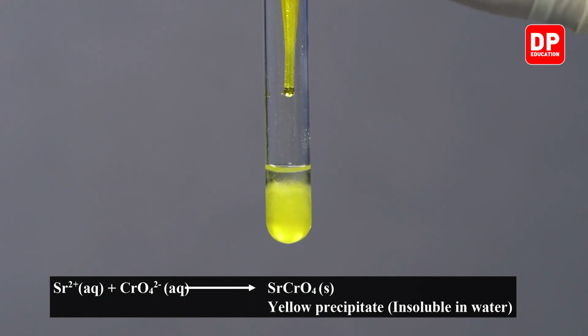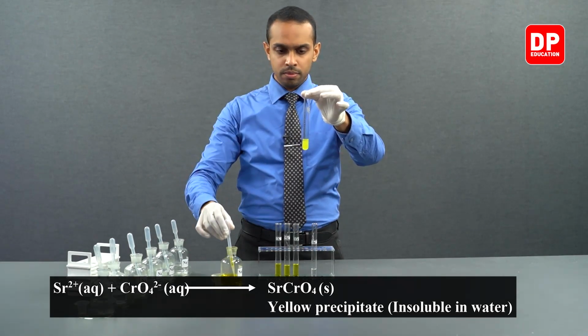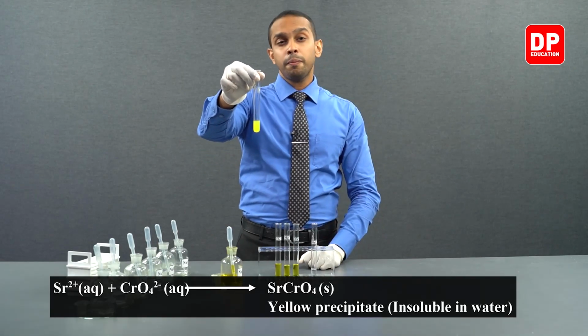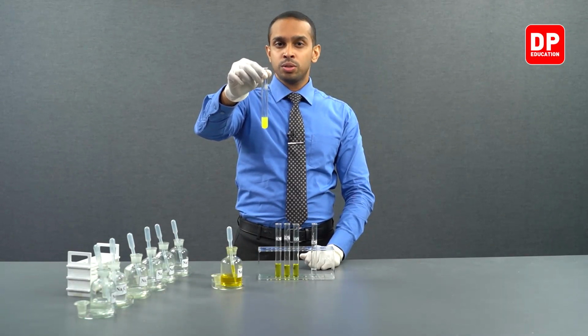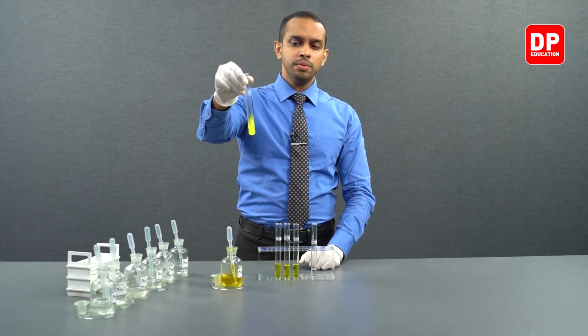We'll add a few more drops. You can see the formation of a yellow precipitate when sodium chromate was added to strontium 2 plus aqueous ion solution. Let's mix it really well.